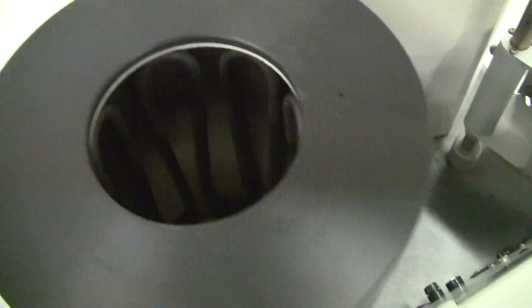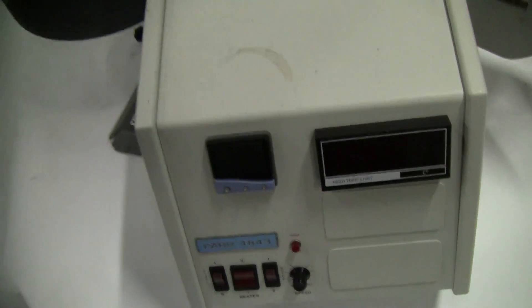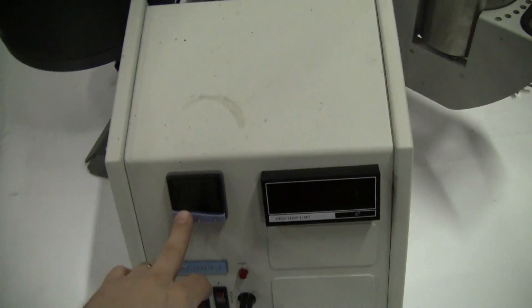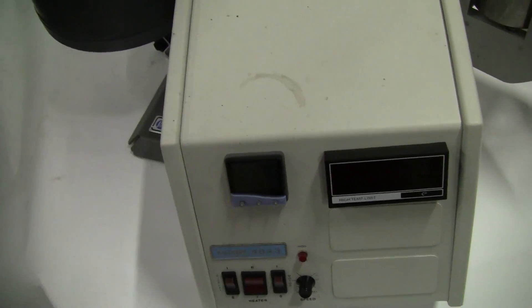Heater. Your simple reaction controller, nothing fancy. High temp limit, temperature set point, on-off, variable speed motor.